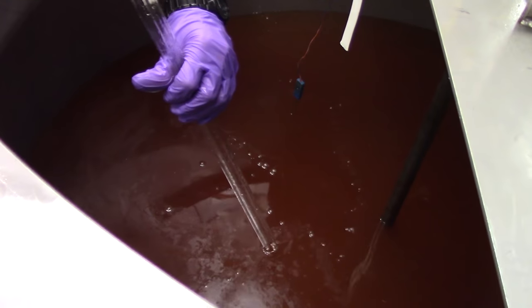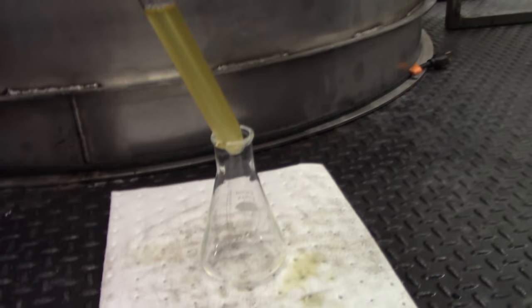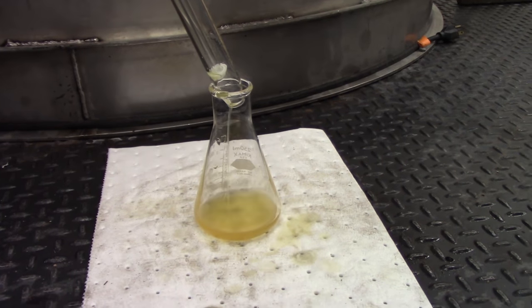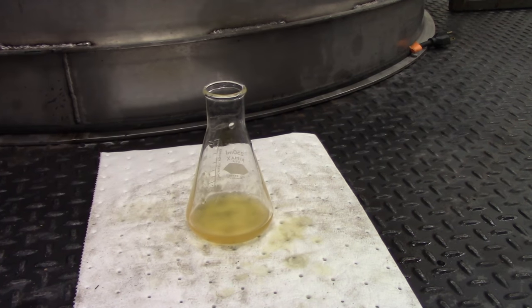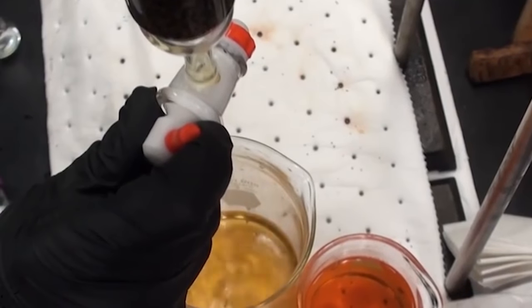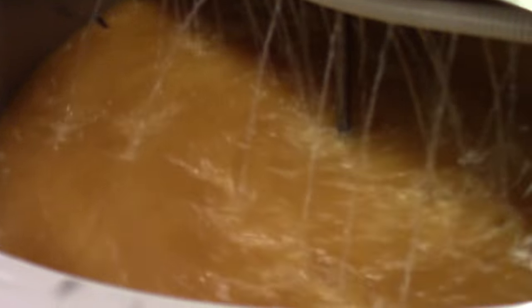The remaining liquid is biodiesel. However, it still has some excess methanol, catalyst, and other impurities mixed in. There are several wash methods, but we prefer to use the water wash method, which is repeated until the fuel is clean.